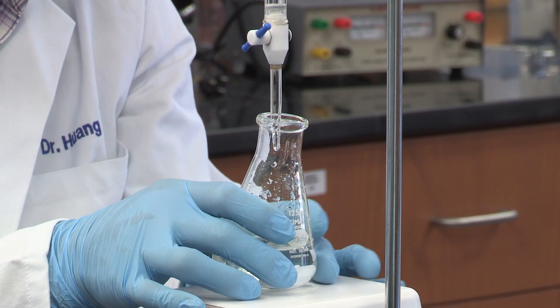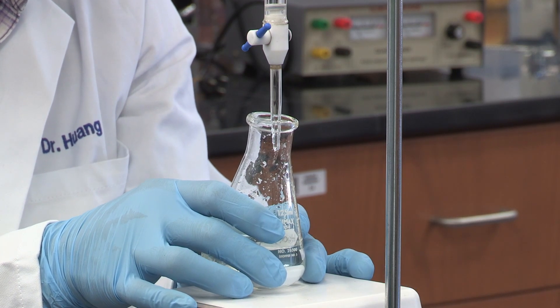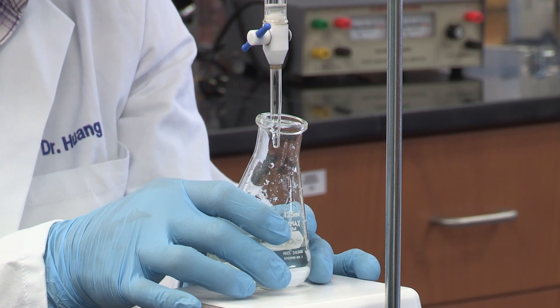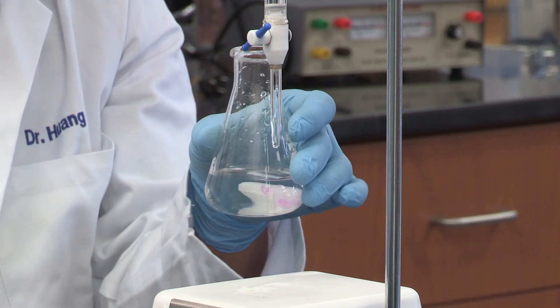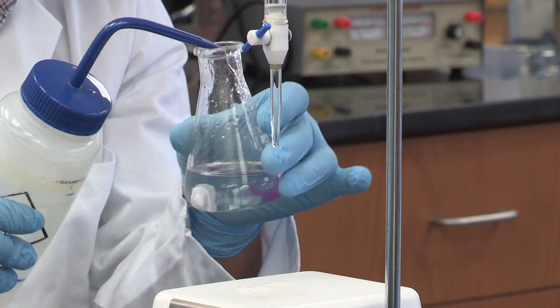Don't tap the burette. Do this. Again, I use this wash bottle to rinse this down.